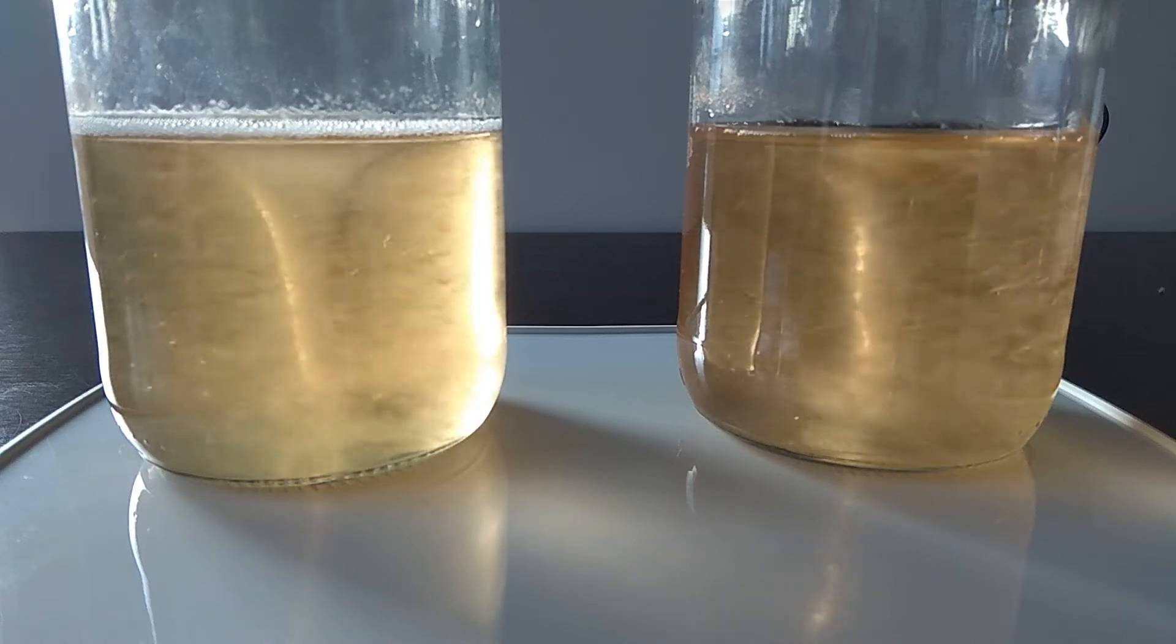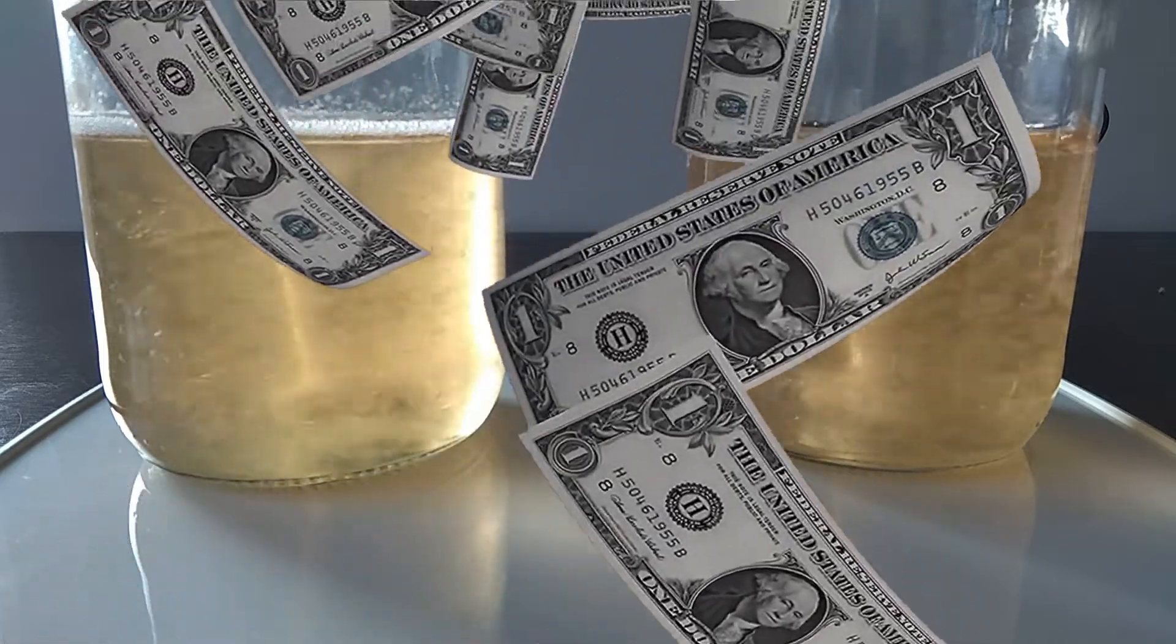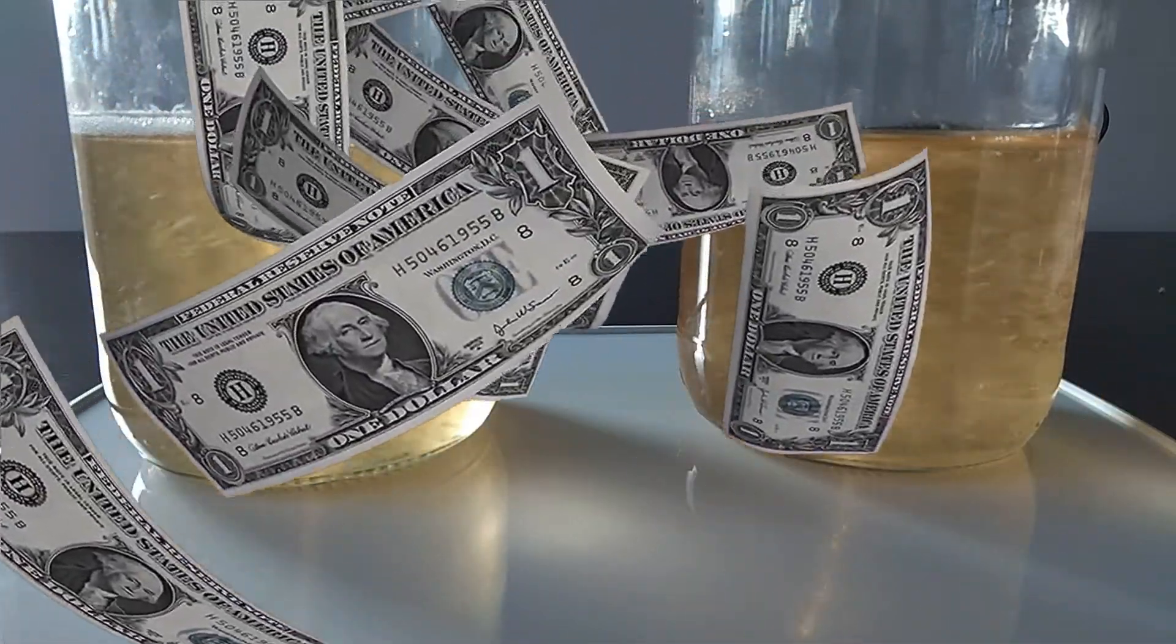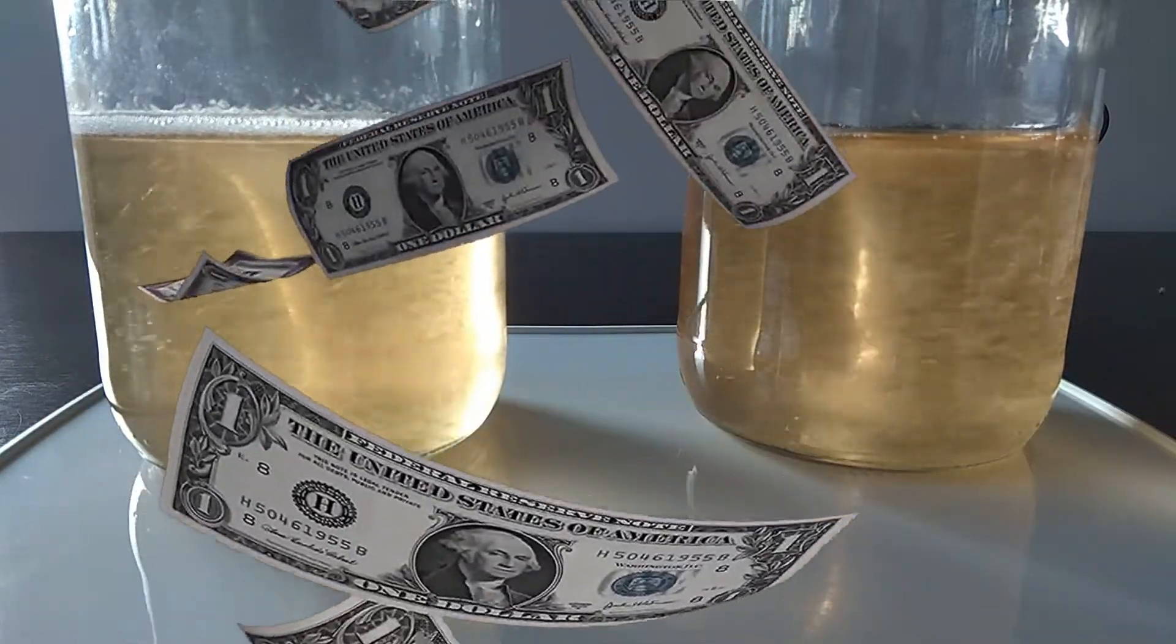Hello to everyone! You can save money by increasing your 10ml liquid culture to 350ml or even more. If you're wondering how this is done, I suggest you watch the whole video.